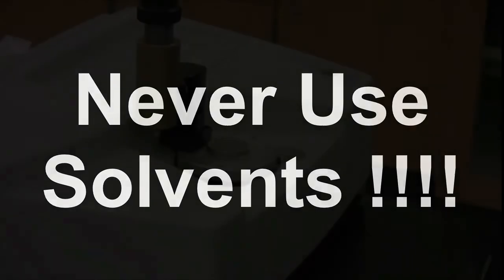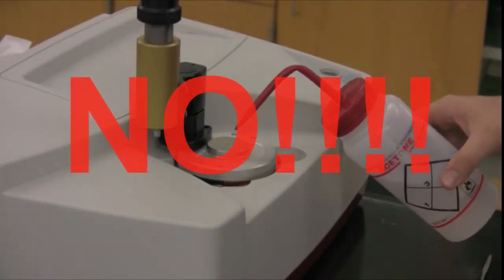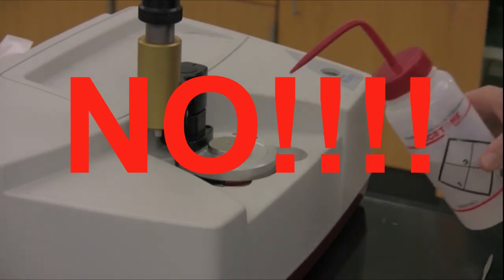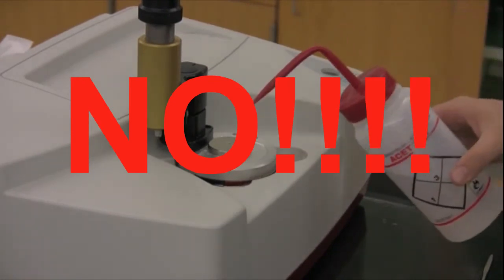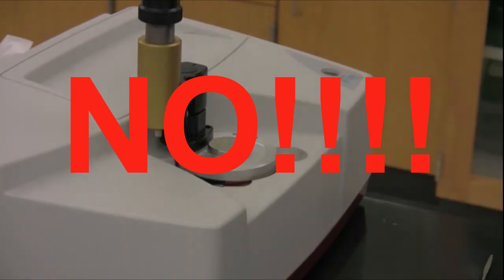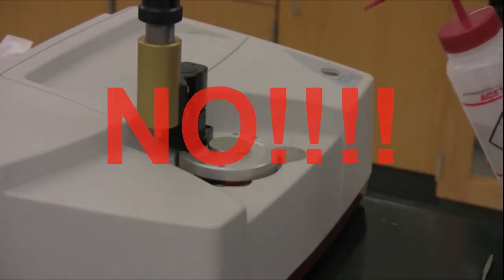What you do not want to do is you never, ever want to use an organic solvent to clean the surface of the diamond. What happens is the organic solvents get trapped down in around the facet of the diamond, and then the vapors from that solvent will always show up in the IR spectrum once it's collected. So you don't ever want to use a solvent. If you ever see a solvent bottle near an IR spectrometer, please take it and put it over by one of the sinks. Someone has probably been making the mistake of trying to clean the diamond with a solvent.